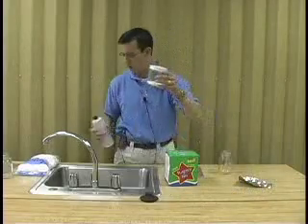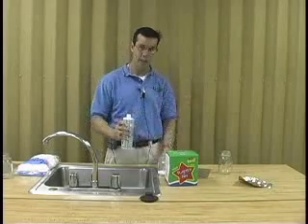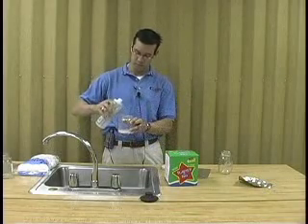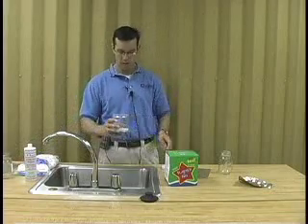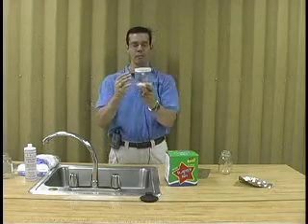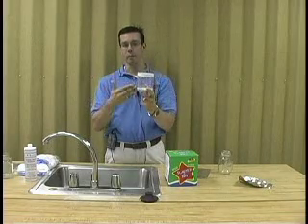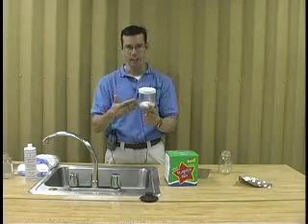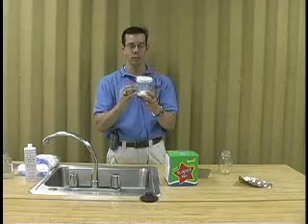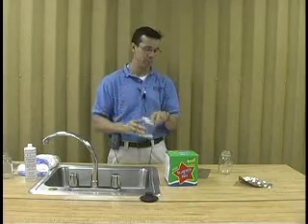I have a completed kill jar right here, and you can see the plaster of Paris in the bottom of the kill jar. Basically, you open it. You take your acetone, you put the acetone in the kill jar, cap it, and allow the acetone to soak in to the plaster of Paris. Now it's important to remember, you do not put enough acetone in here that it is floating on the top of the plaster of Paris. You do not want to drown your insects. You want to kill them based on the fumes that are being emitted by the acetone. So you allow the acetone to soak in, and at this point, it is charged and ready for use.